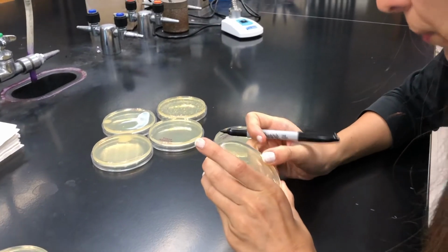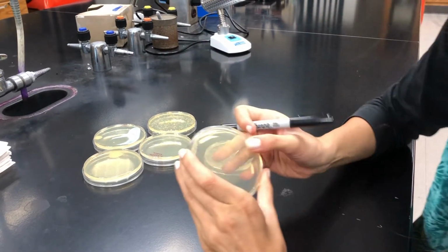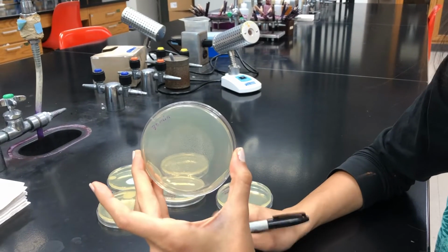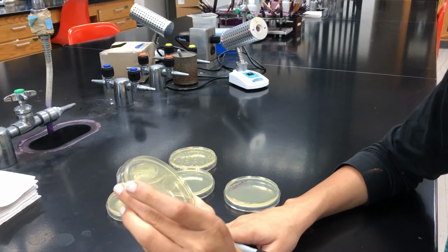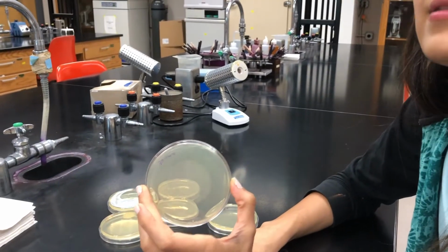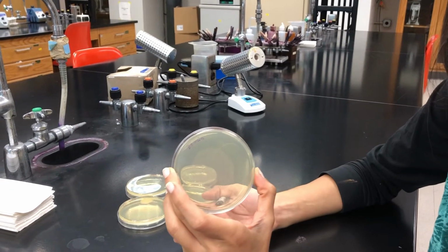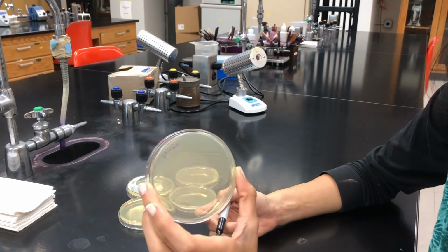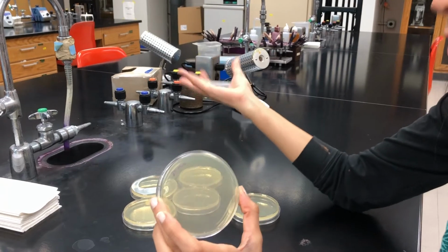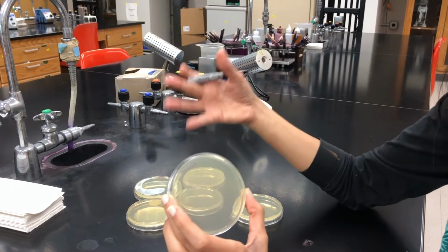This is when we put the plate for 30 minutes on our bench top, no bacteria grow. But sometimes you can see tons of bacteria grow even when we put our plates in a room, I mean in open air.